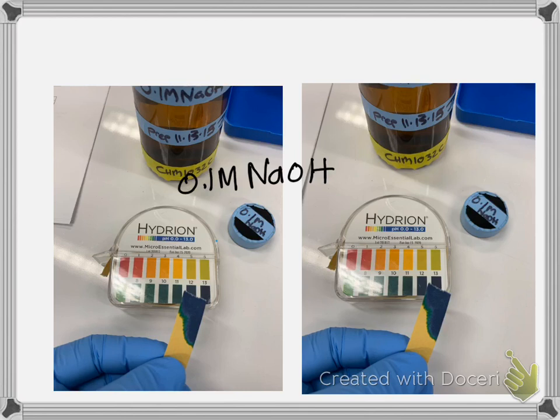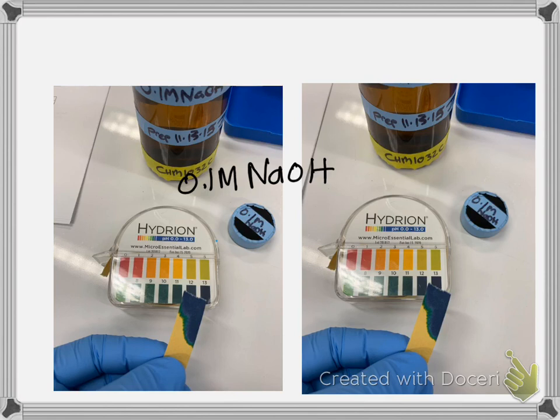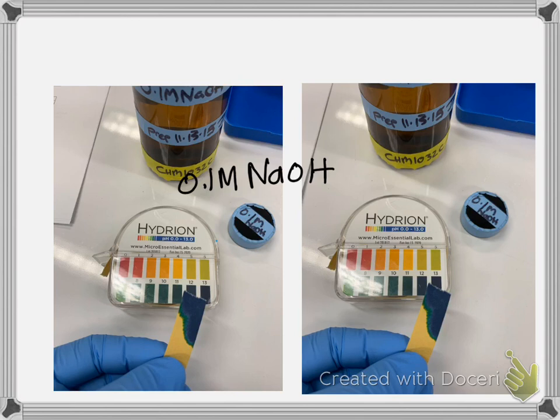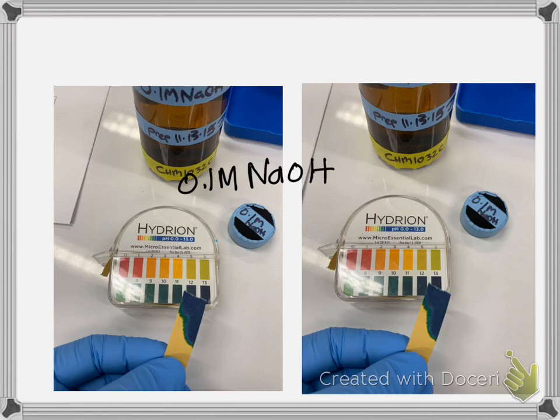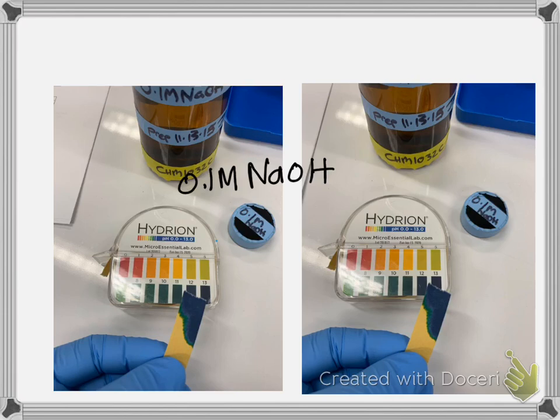That's part A of the lab. It really is simply looking at the pH paper and trying to determine the pH of the acids and bases. Remember, if the number was less than 7, that substance would be acidic, and if it was greater than 7, that substance would be basic. We are not using the pH meter, so you can either leave that blank on your data page or put a line through it.